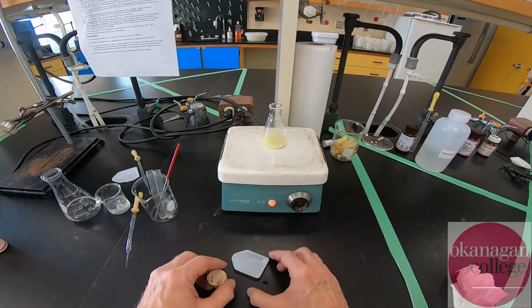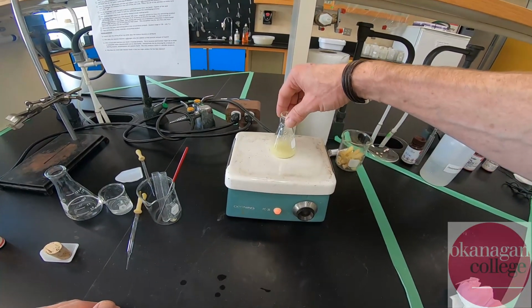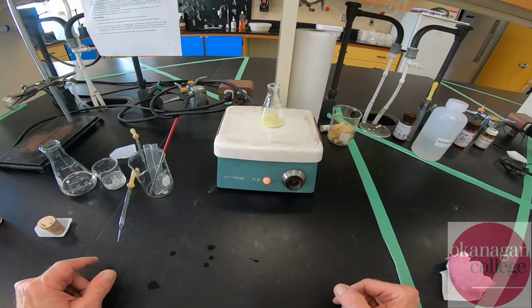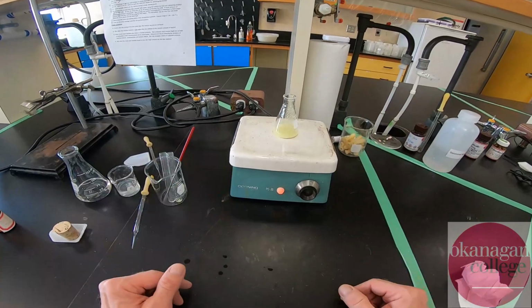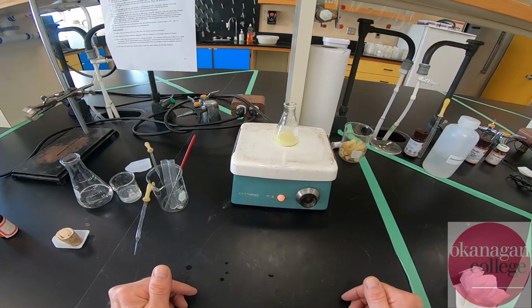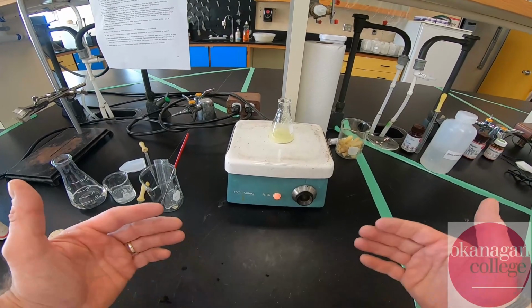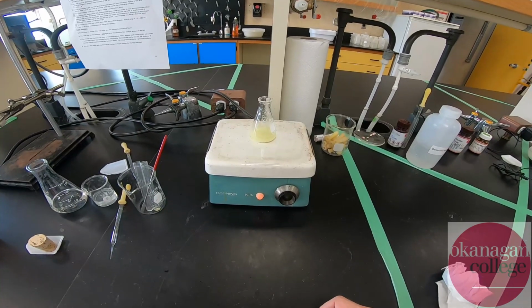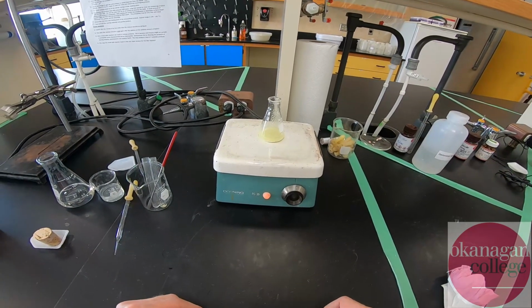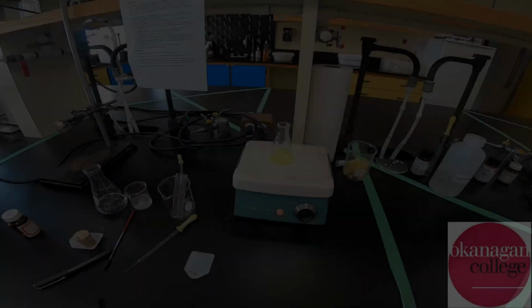Okay, so I've got the stuff transferred onto the hot plate. It's warming. It'll take several minutes. And again, a reminder, we always use an Erlenmeyer flask for recrystallizations because of its conical nature. We don't lose nearly as much through evaporation because the conical shape of the flask helps condense the vapor and reintroduce it back into the solution. All right, so with the boiling chips, we'll give this a few more minutes and see what happens.